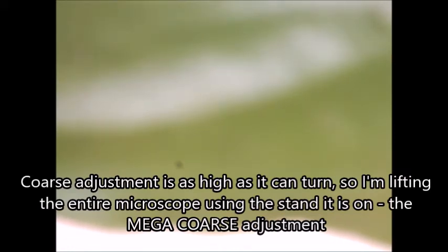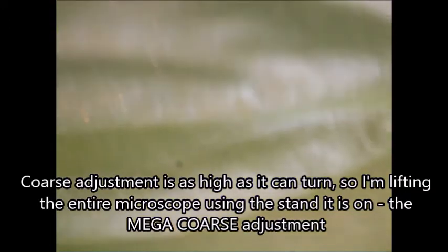So we're looking through the digital stereo microscope right now, and I'm going to try and focus this by using the coarse adjustment and slowly moving it up away. Okay, so I've now hit a point where this is as high as it goes on my coarse adjustment. So I'm going to move it up from that. Do you remember that knob I showed you that slides the entire microscope up and down its stand? I'm going to move that now. So that looks a bit clearer. So I'm just tightening that now, and I'll go back to the coarse adjustment and try and get it a bit more in focus. Okay, so there's our leaf.